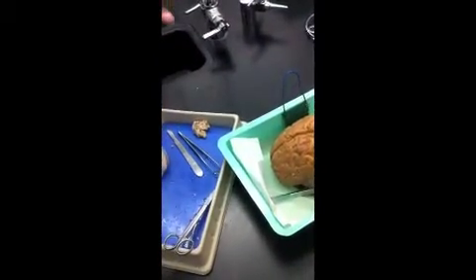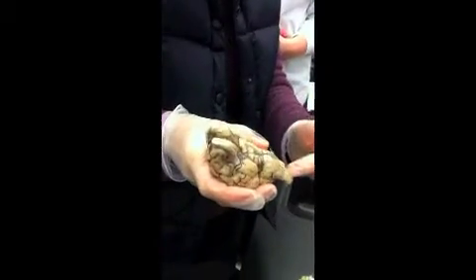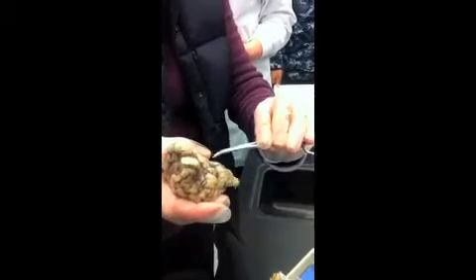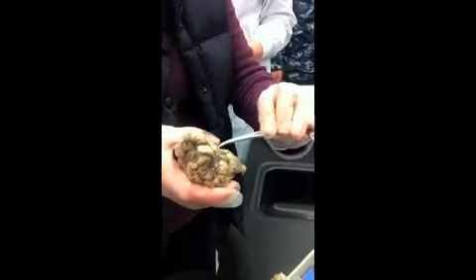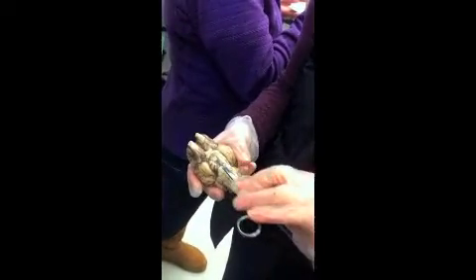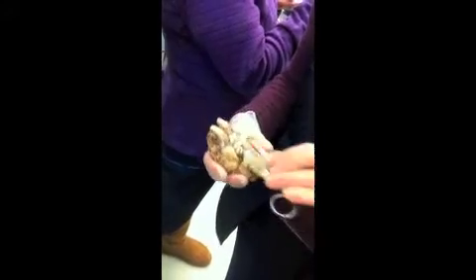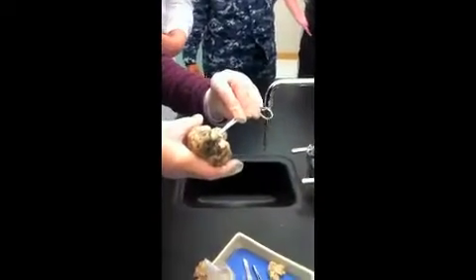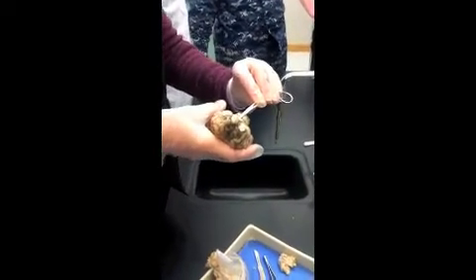Okay, now, the cerebrum's kind of like the cap of a mushroom, and you could call the brain stem the stalk that it sits on. This is all brain stem. Well, this part. From about here down is brain stem. Just above the brain stem, we have the area of the diencephalon. So the brain stem would start about here, going down to here, and then this area, sort of underneath the chiasm, is the diencephalon. The diencephalon is where we find the thalamus.